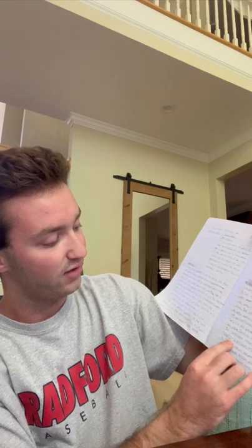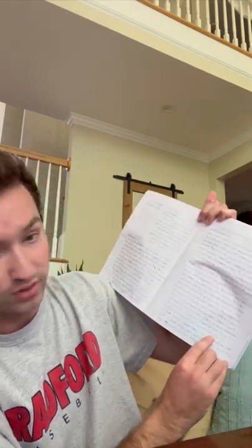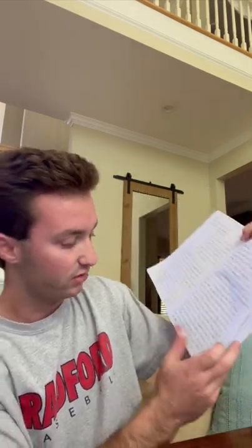And the balanced chemical equation I put for this one was 2Al in the solid state plus 6HCl in the aqueous state yields 2AlCl3 in the aqueous state and 3H2 in the gaseous state. So finally, for my fourth reaction, which was copper chloride reacting with another piece of 2x2 aluminum foil.